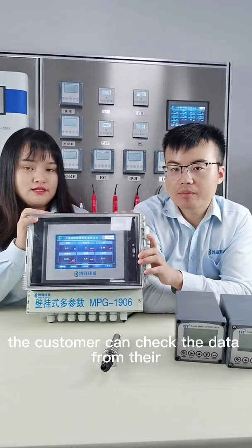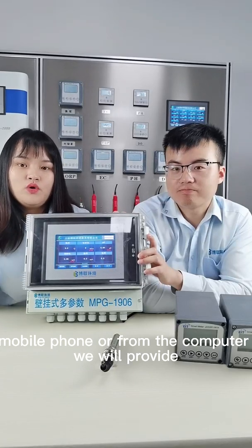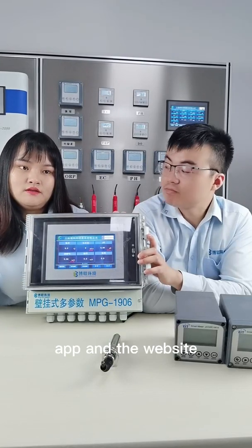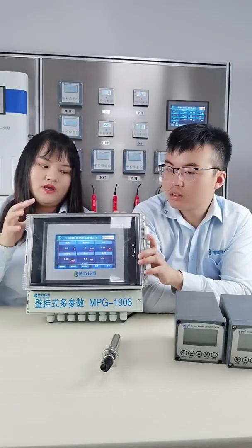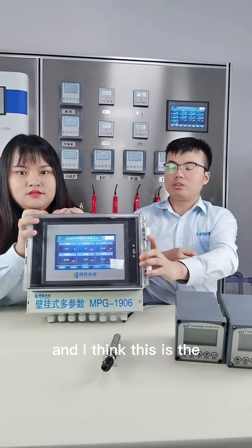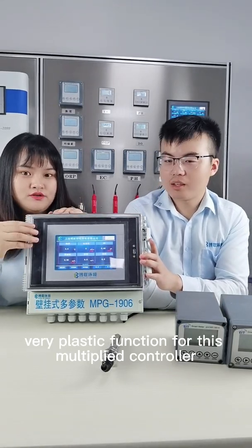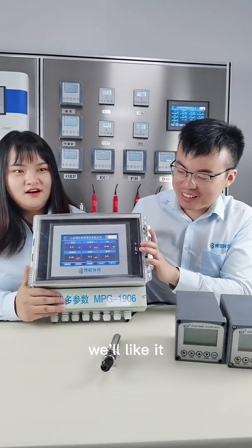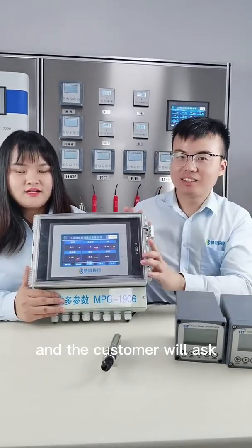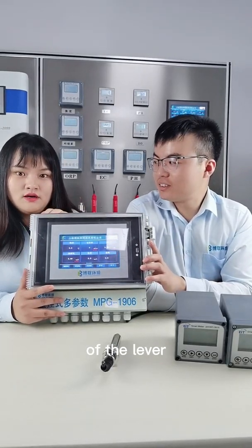The customer can check the data from their mobile phone or from their computer. We will provide the app and the website. You can check the data anywhere and anytime. It's very convenient, and I think this is the very basic function for this multi-parameter controller. Well, it is great. Maybe our customer will like this product. And the customer will ask, can this controller also test the flow or the level?